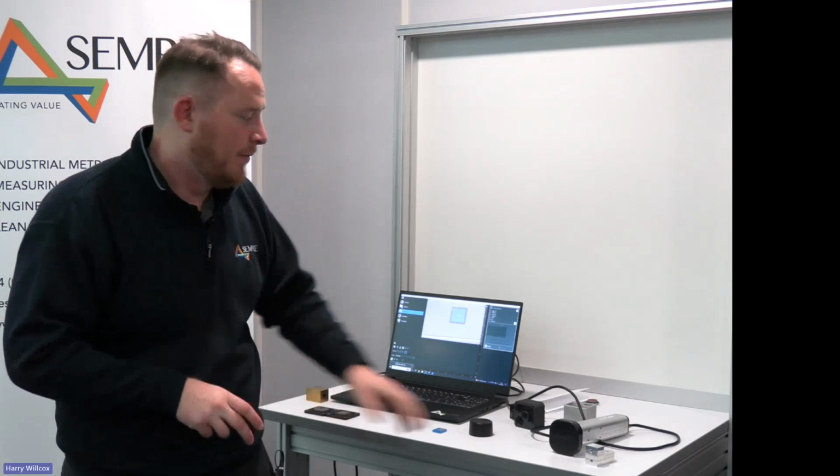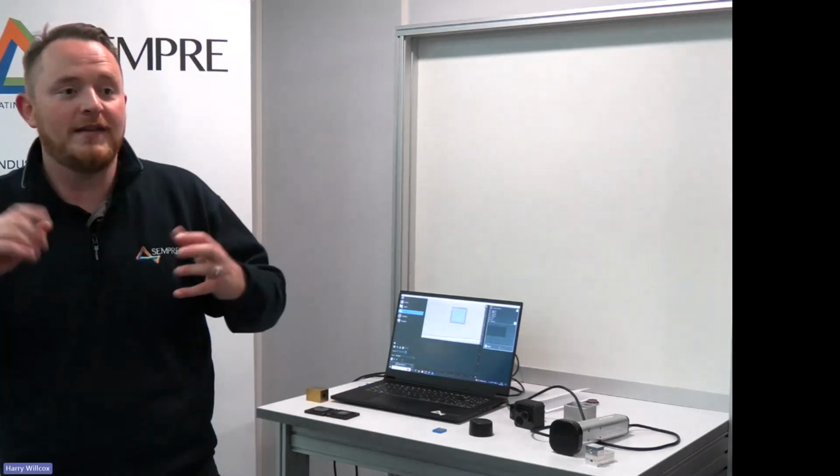So in theory, we should be able to see a 10, 15, 20 micron chamfer. It shouldn't really be a problem on the Gelsight Max system. I'd probably say upwards of 25 microns on the Gelsight Mobile Series 2. So it's just dependent on the specifics. If you've got anything in mind, then please get in touch, and I'd be happy to try it. It's the best thing to do. We've got some samples here, so if you've got a specific size in mind, I can look to scan it on the system that we've got here and see what happens, basically.